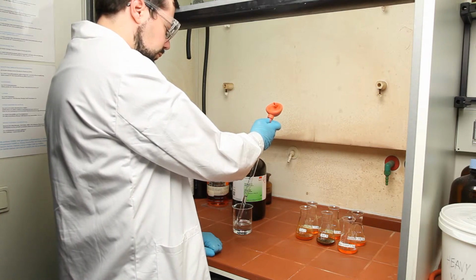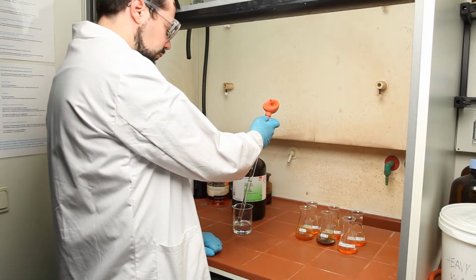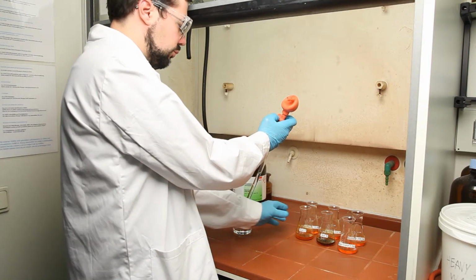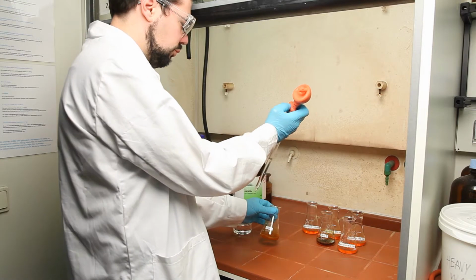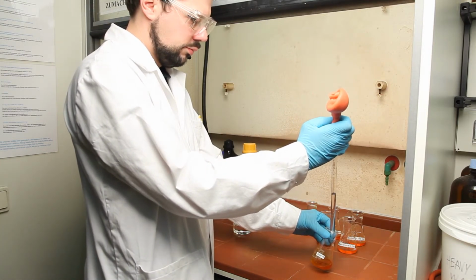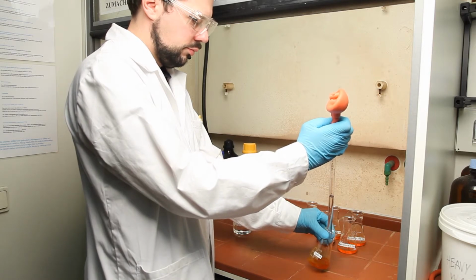During the reaction, the sample becomes very hot and may start to boil. Add the acid only dropwise and allow some time for cooling if necessary. Always work in the fume hood and do not direct the opening of the flask towards you.